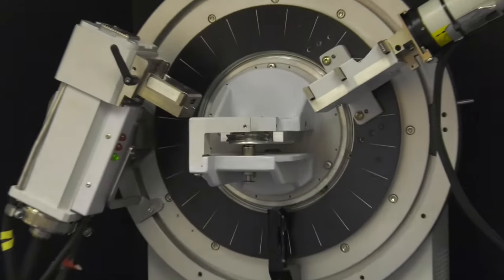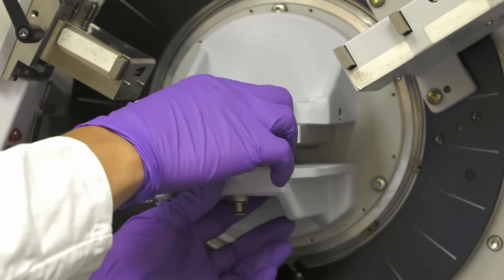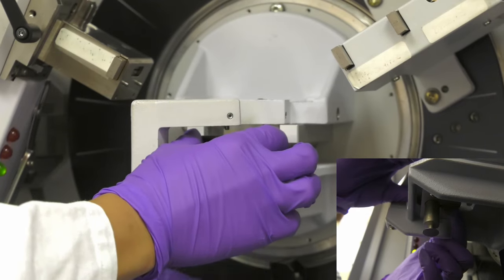To remove the sample holder from the sample stage, a latch underneath the sample stage is gently pulled while holding onto the sample holder.